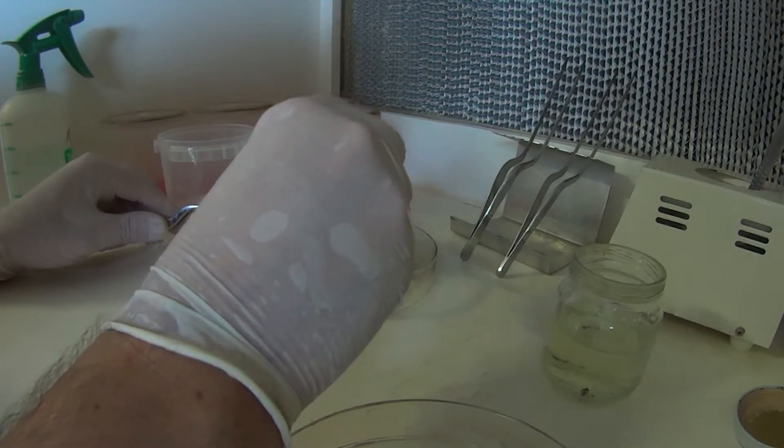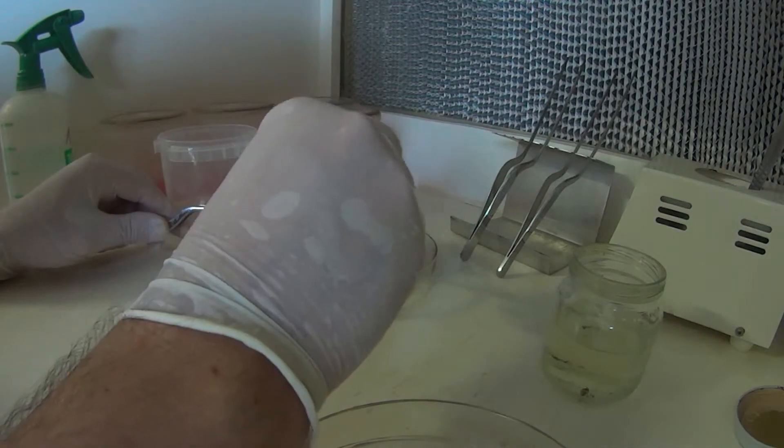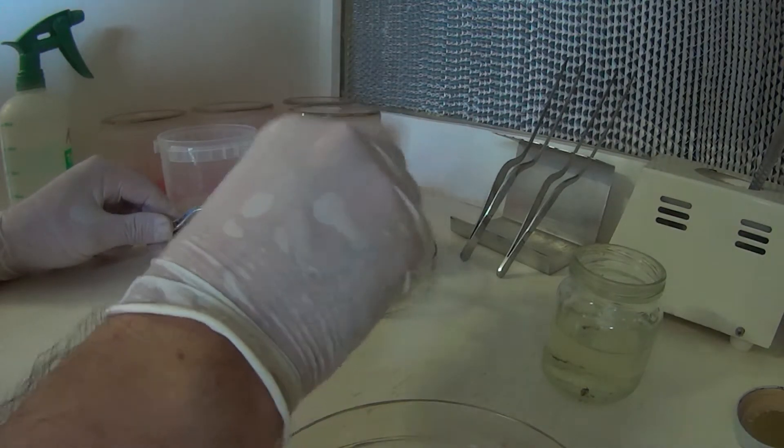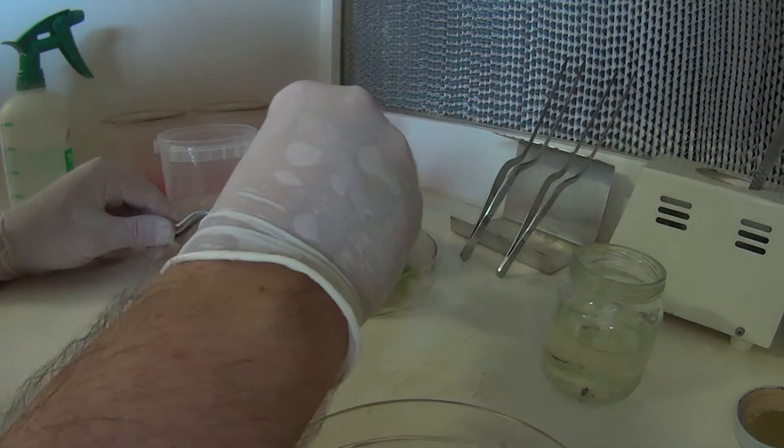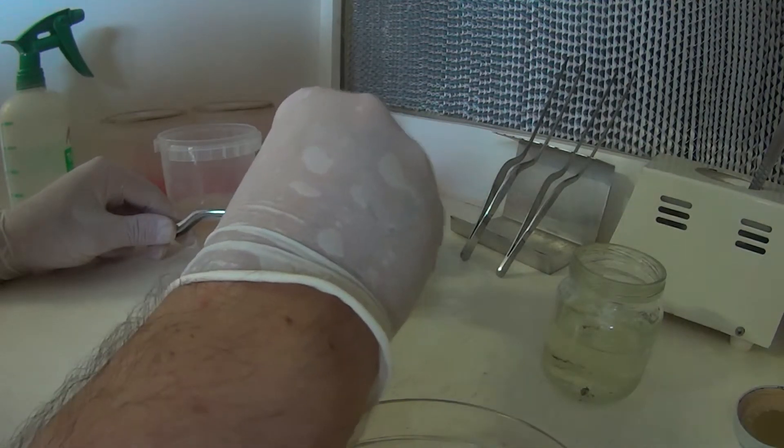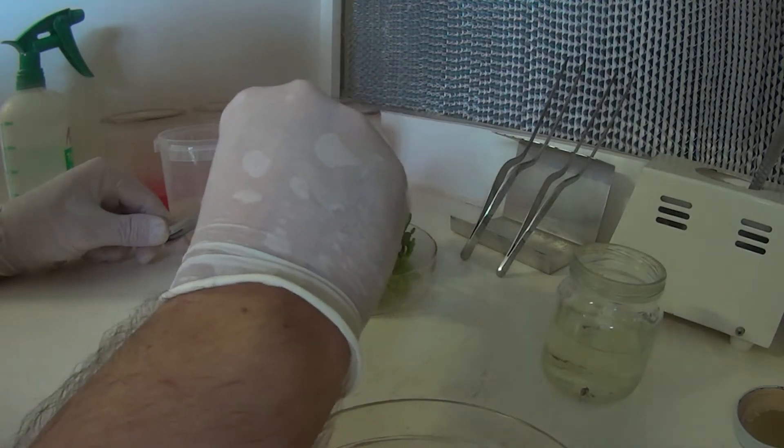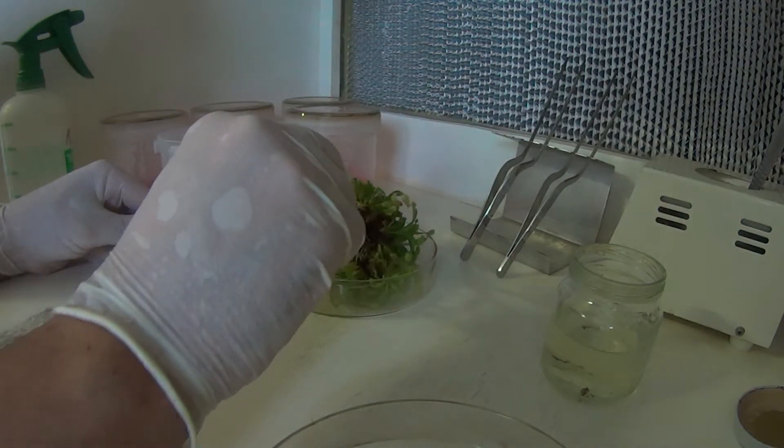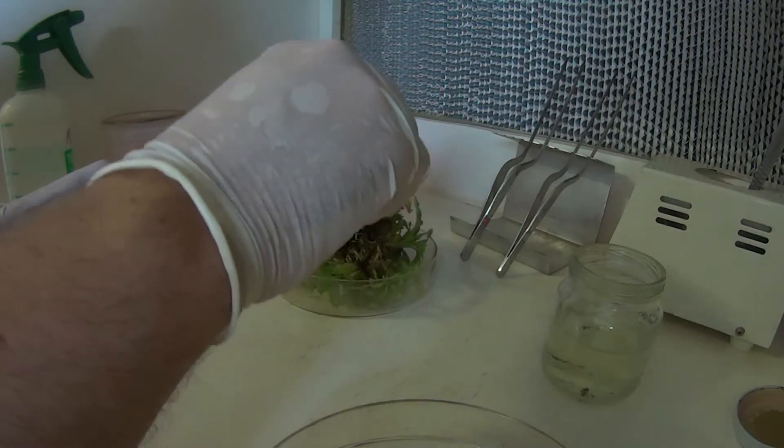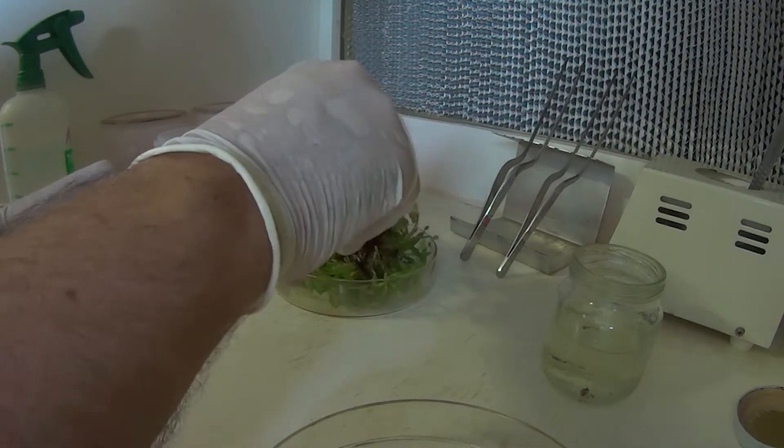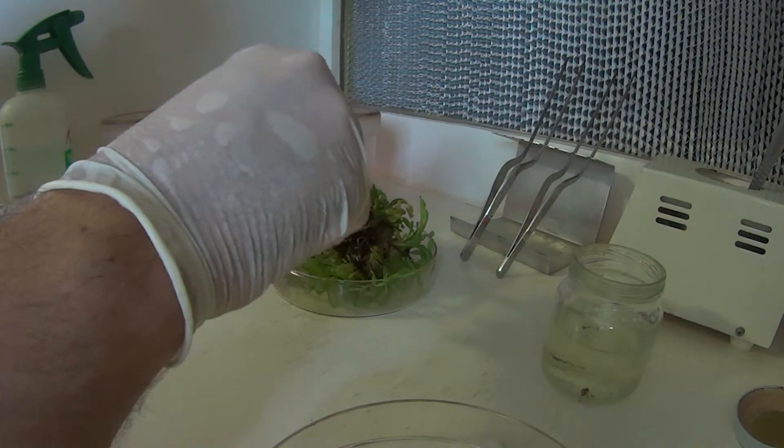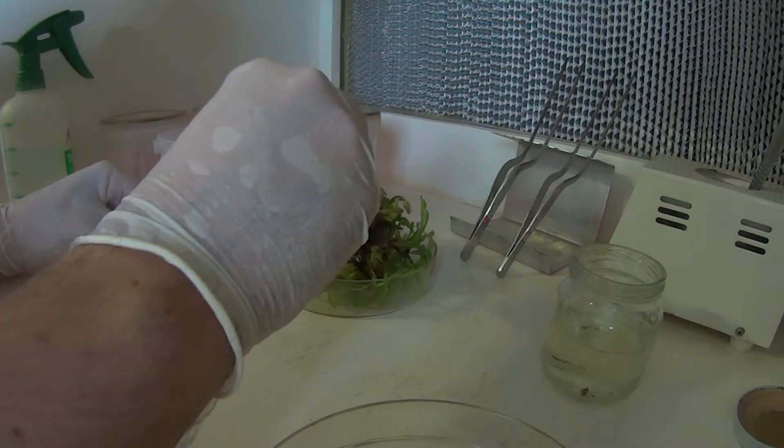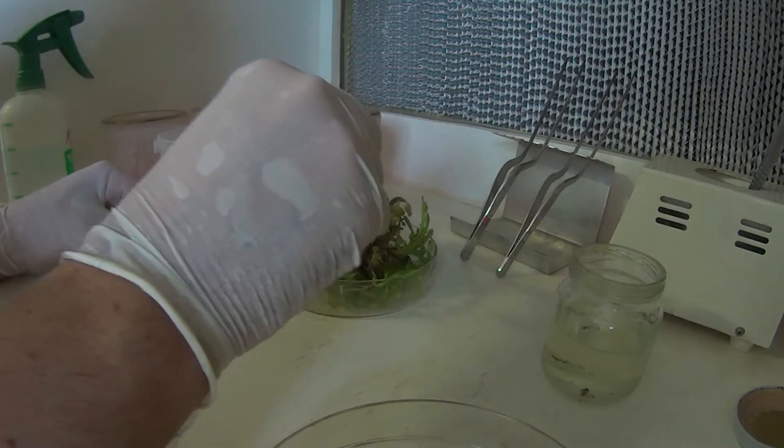It's pretty time consuming. In the end I'll just lose patience with it and just start hacking at it, and then find out what plants are there after I've finished chopping it up. This is a fairly large kind of plant. Dropping some.